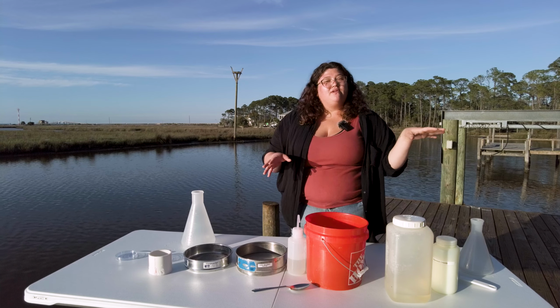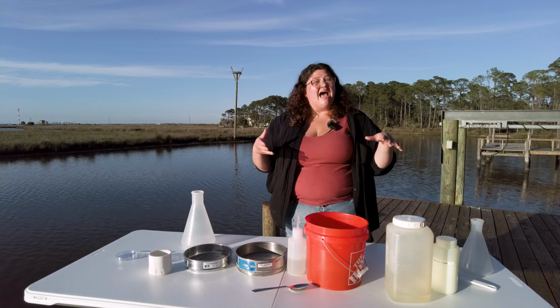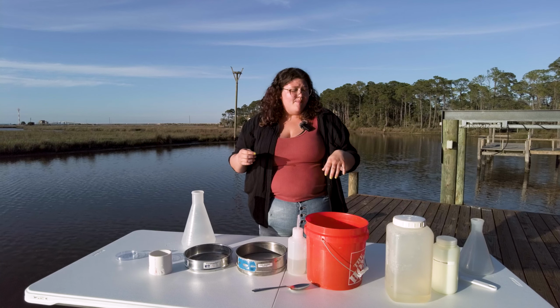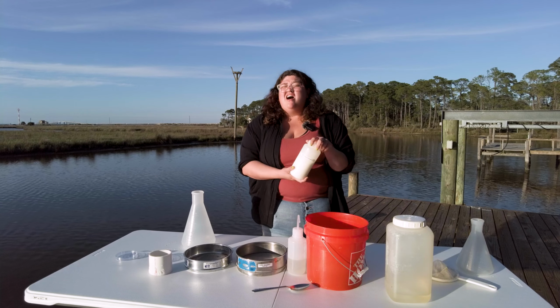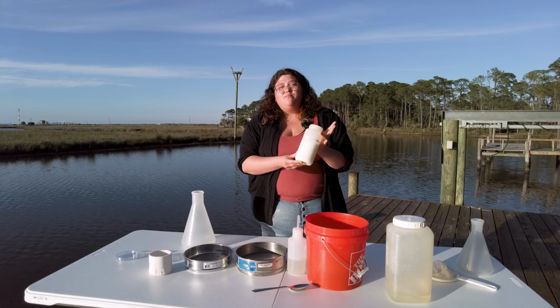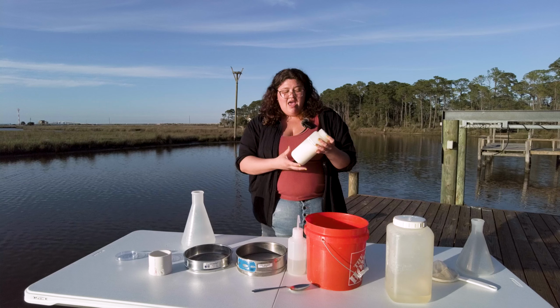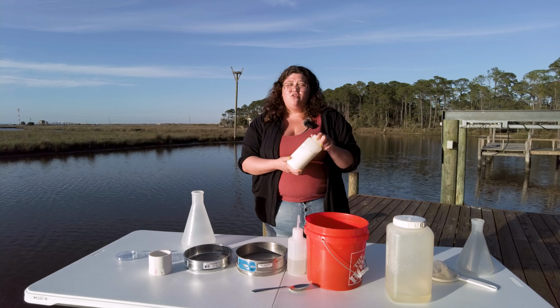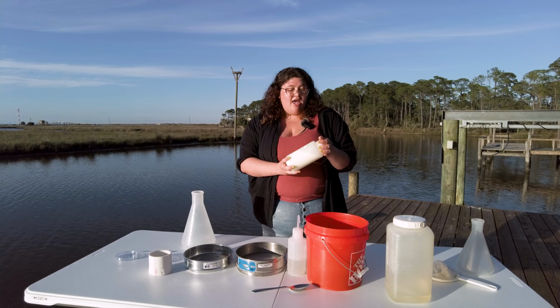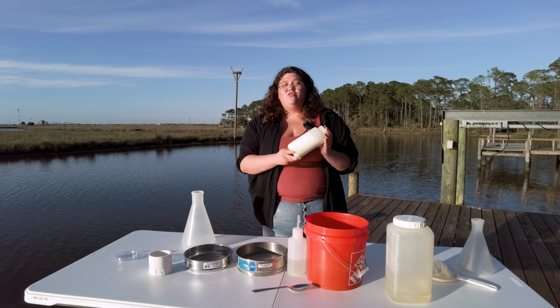So magnesium chloride relaxes the animals. What it does is it disrupts the metabolism of the little animal's muscle system. If you're a little meiofaunal animal, a lot of these things have sticky structures. They want to stick on to the sand because you don't really want to leave your house. And so what we do then to unstick them from those sand grains is use magnesium chloride. You can get this just at Home Depot or Lowe's or any hardware store. The magnesium chloride we use is the same that you use to de-ice the road or your sidewalks during the winter. So it's actually something that you might already have at home or you can easily go and get.